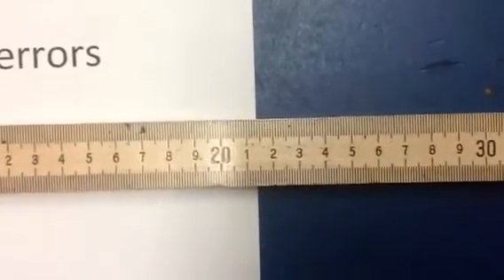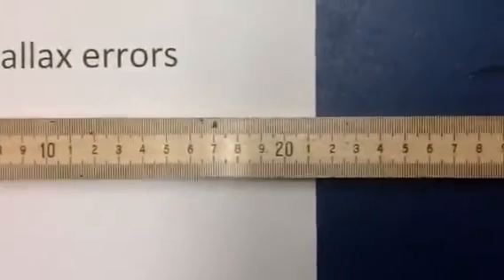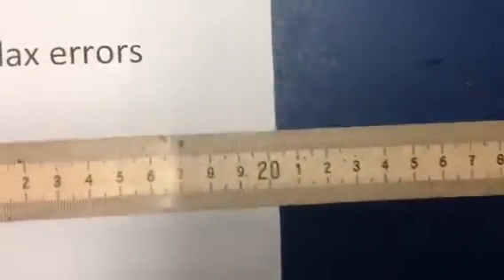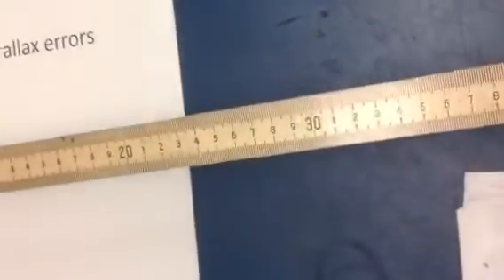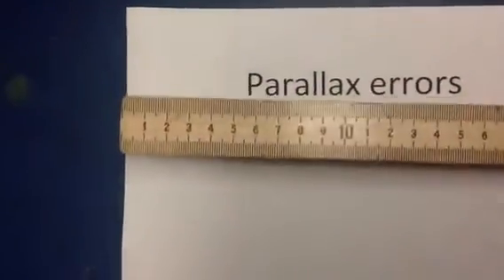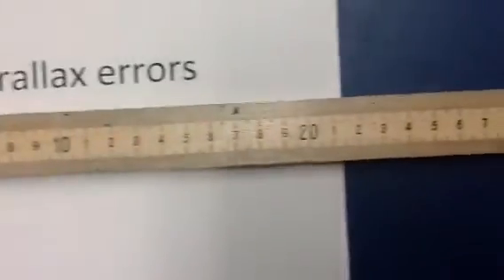But one thing I want to point out is another way of reducing it is by getting the device in question as close to the measuring device as possible. Look what I'm going to do. I'm going to lift this up in the air. Now look how much difference I can get when it's up in the air, far away from what I'm trying to record. So one way of reducing parallax errors is to get the measuring device as close to the thing I'm measuring as possible.